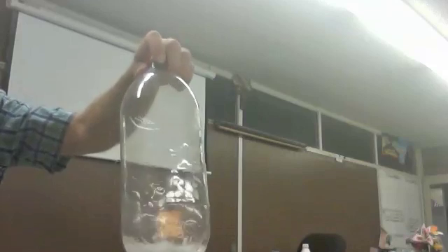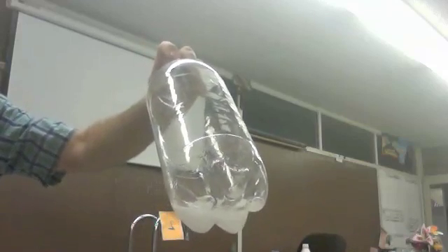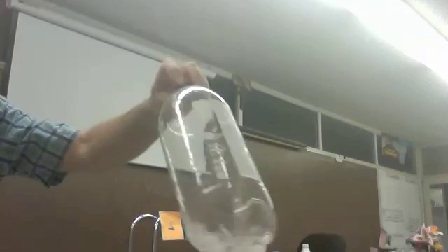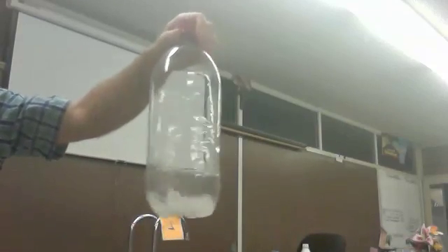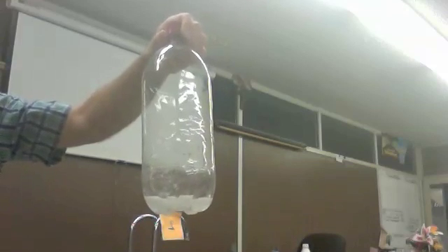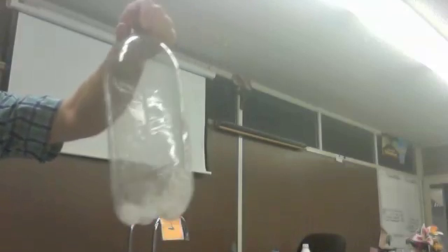And eventually what's going to happen here? It's just going to become a part of the water — it's going to be gone. And it made a gas, right?